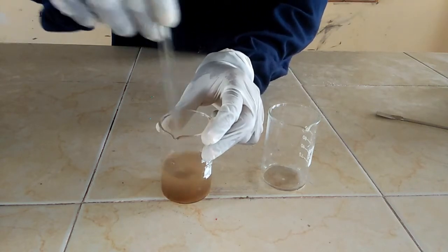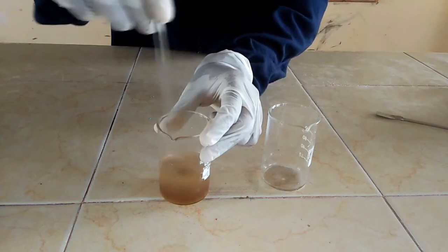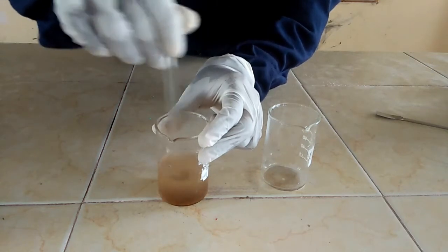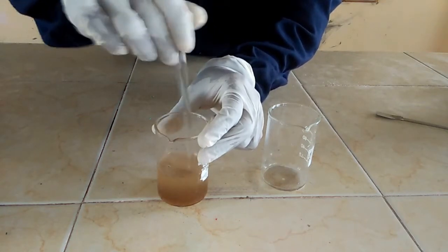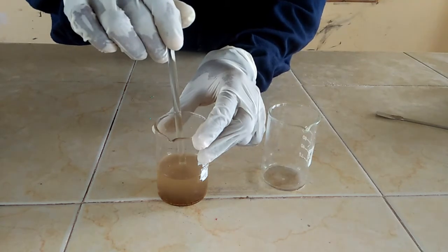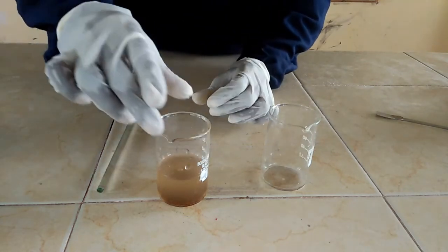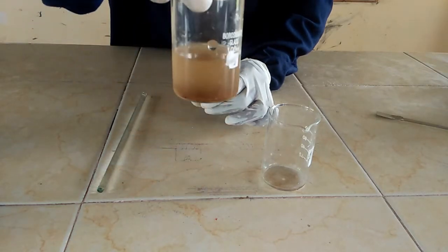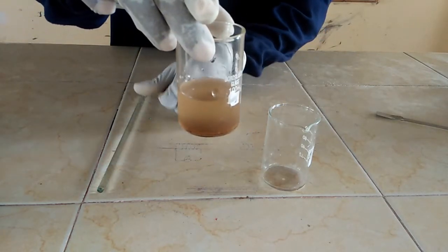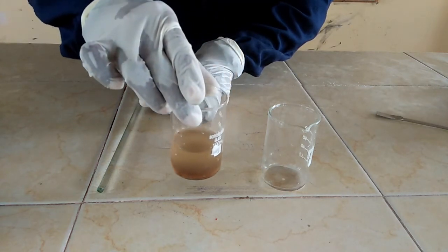I am going to stir so that you can see if it is soluble. We stir the mixture, however much we stir, the sand will not dissolve in water. Our sand is still there — you can see at the bottom of the beaker we still have sand.